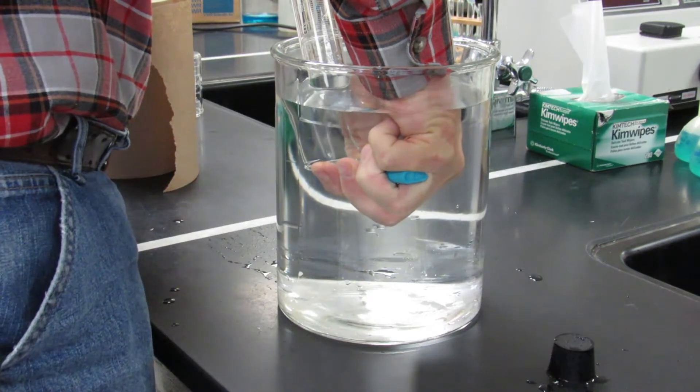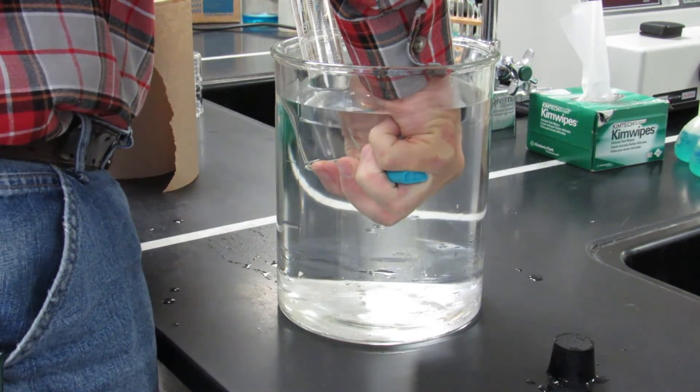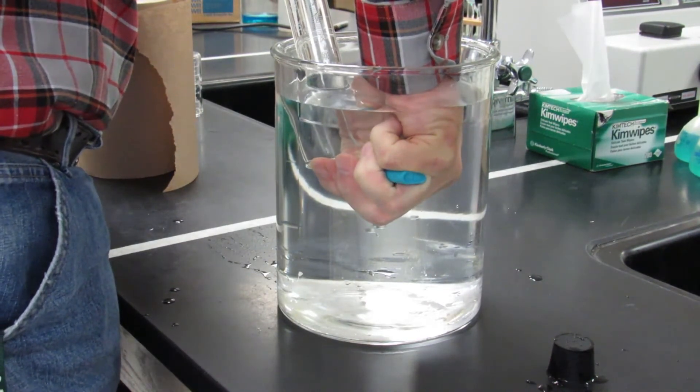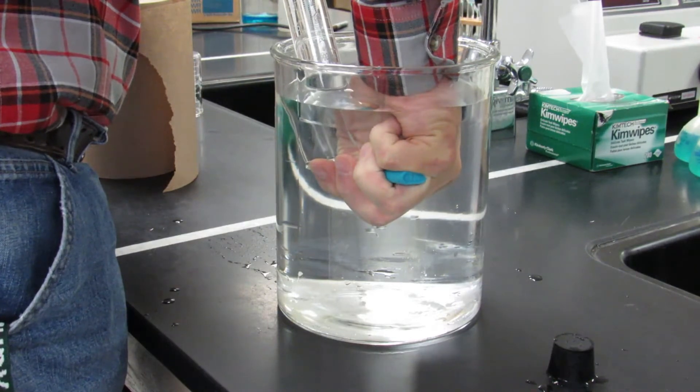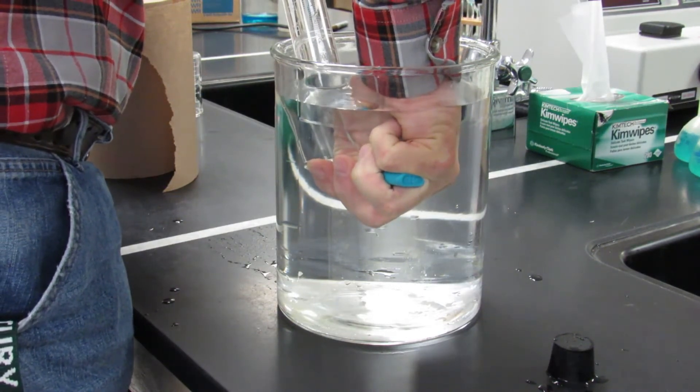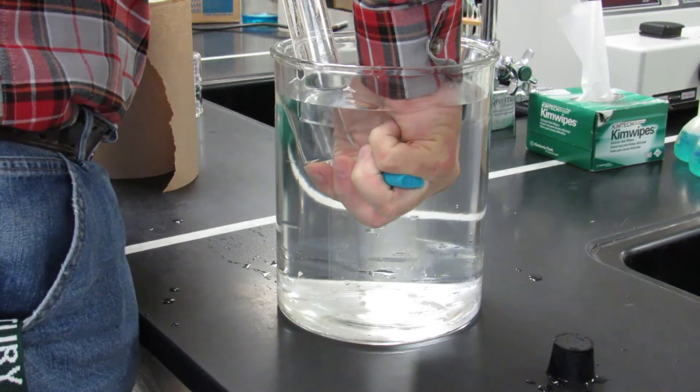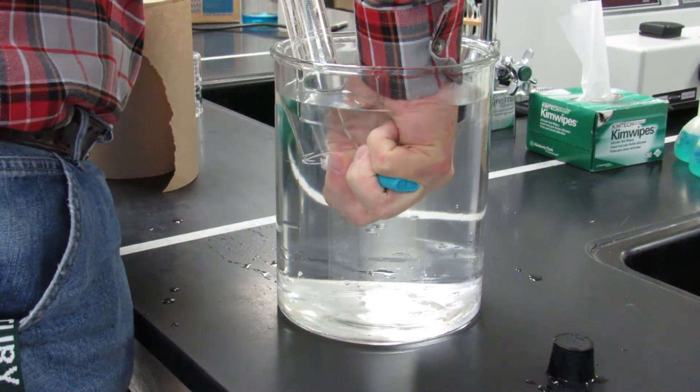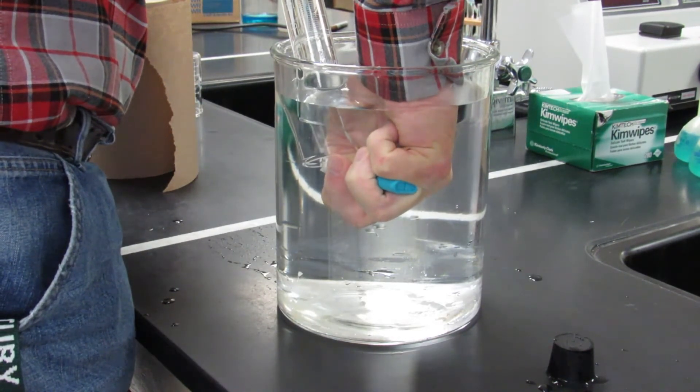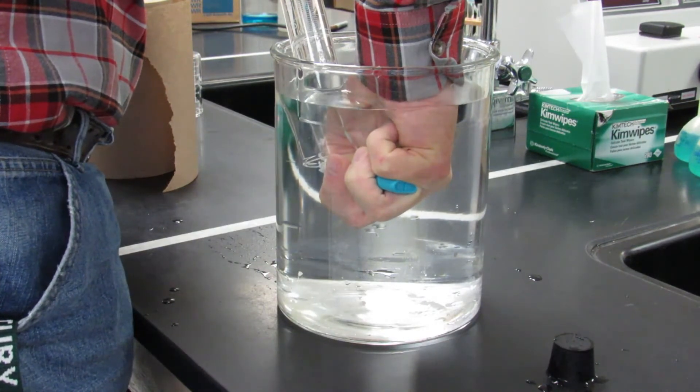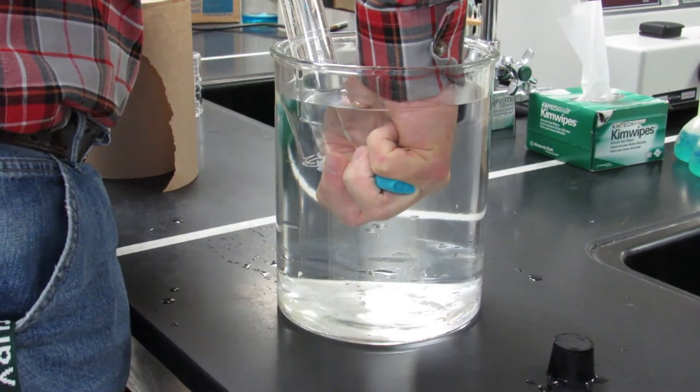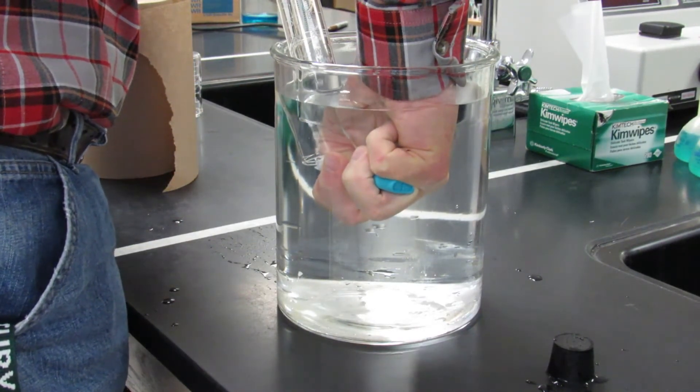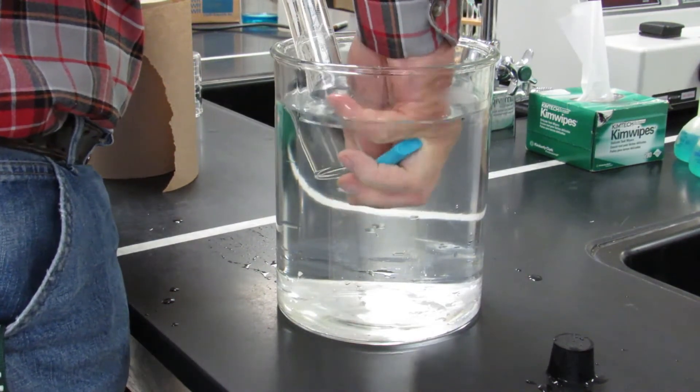And then essentially for the next couple minutes, just gonna let gas leave the lighter. You can see the little bubbles there. I allow the gas to leave the lighter and fill the graduated cylinder. Definitely not one of the most exciting labs to perform, but we need to collect the gas.